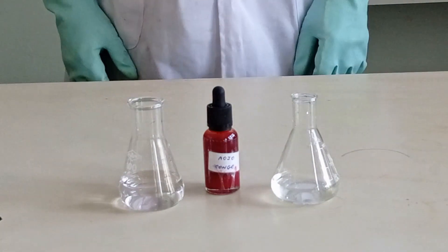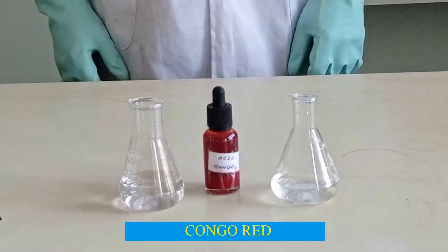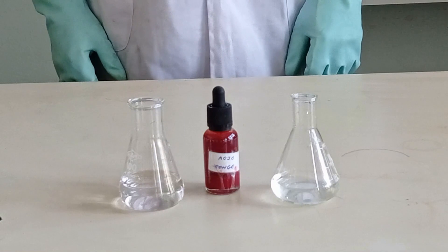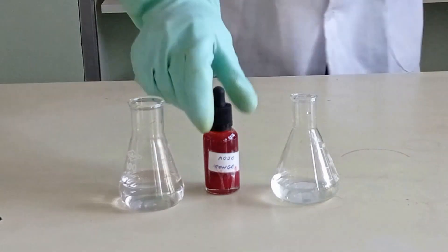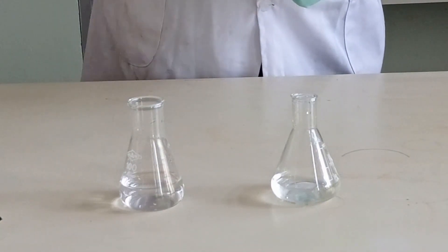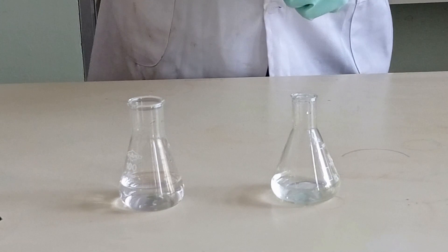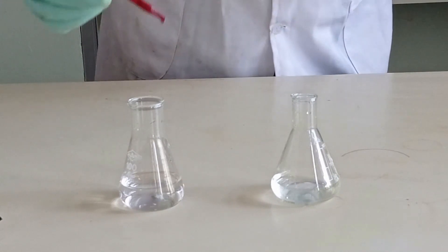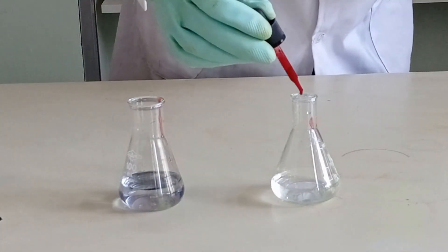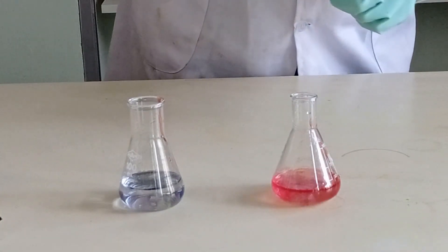This is Congo red. Congo red in an acidic medium is violet, and in a basic medium it is red.